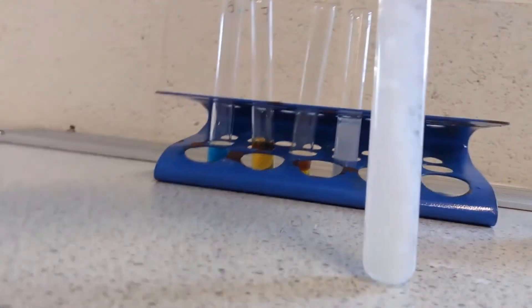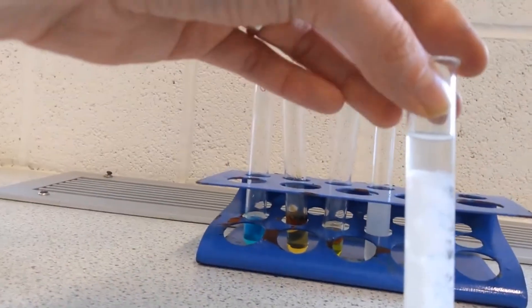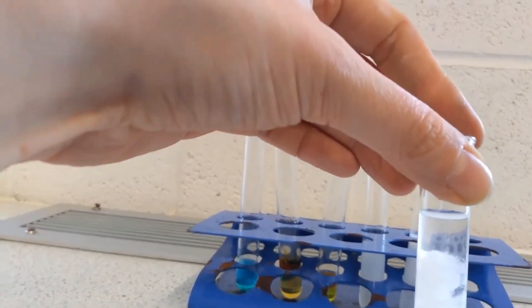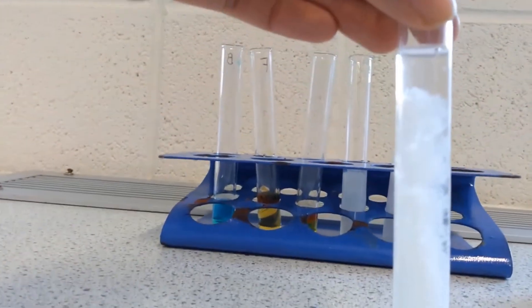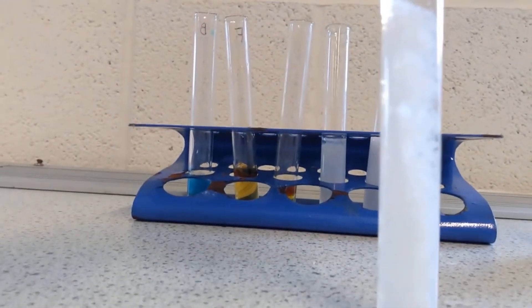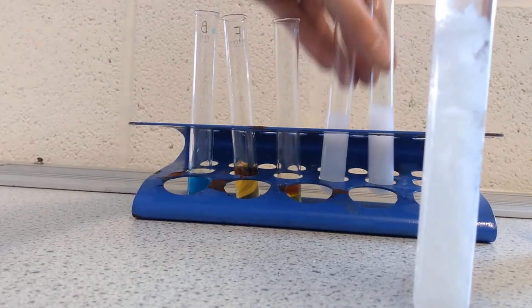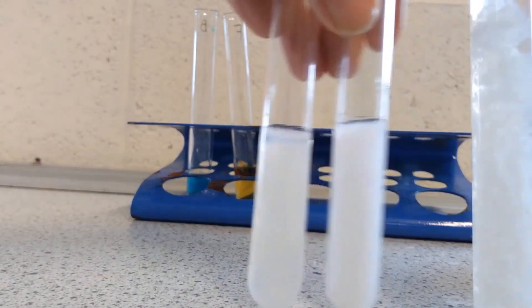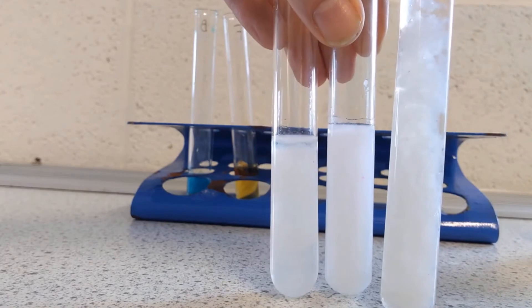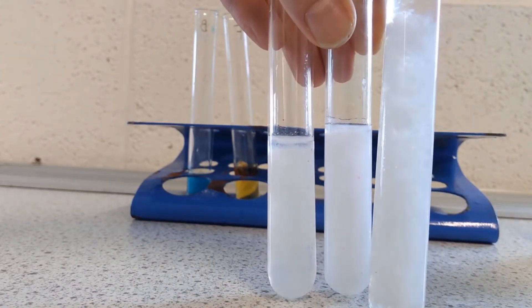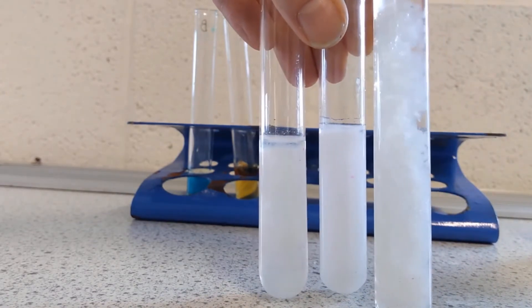If I lift the camera up slightly so you can see the top of the tube, the top of the tube is starting to clear out, and that is very much starting to re-dissolve. If I compare it to the other two, you can see they're still opaque. They still have precipitate, but my aluminium is separating out.